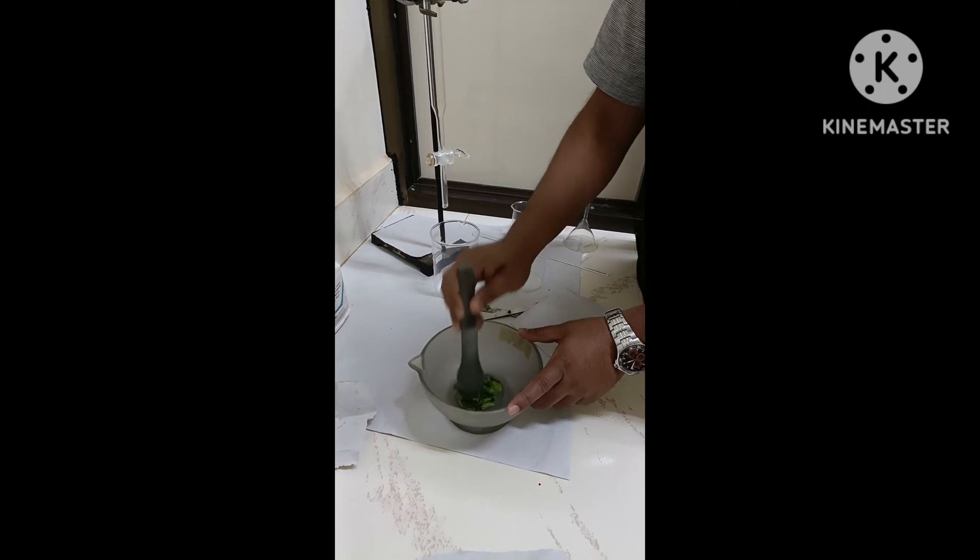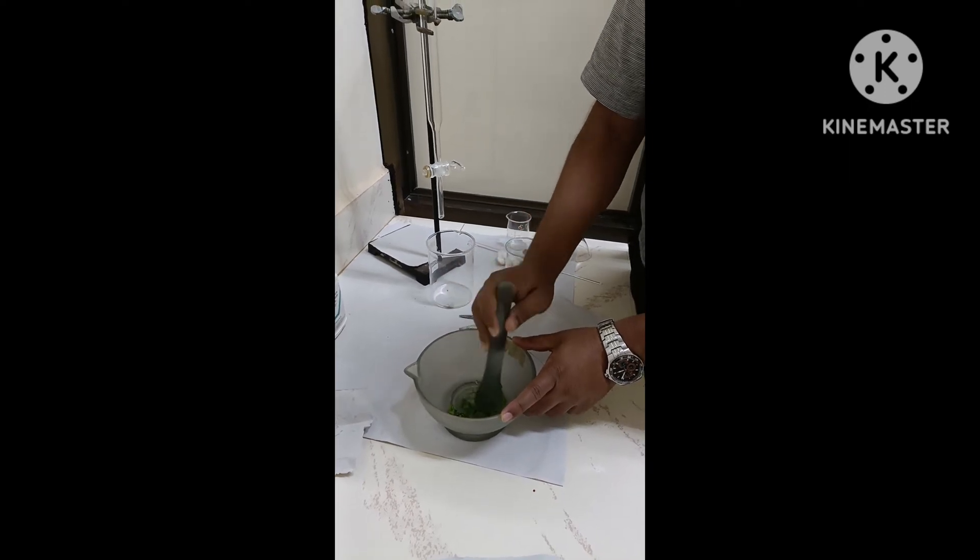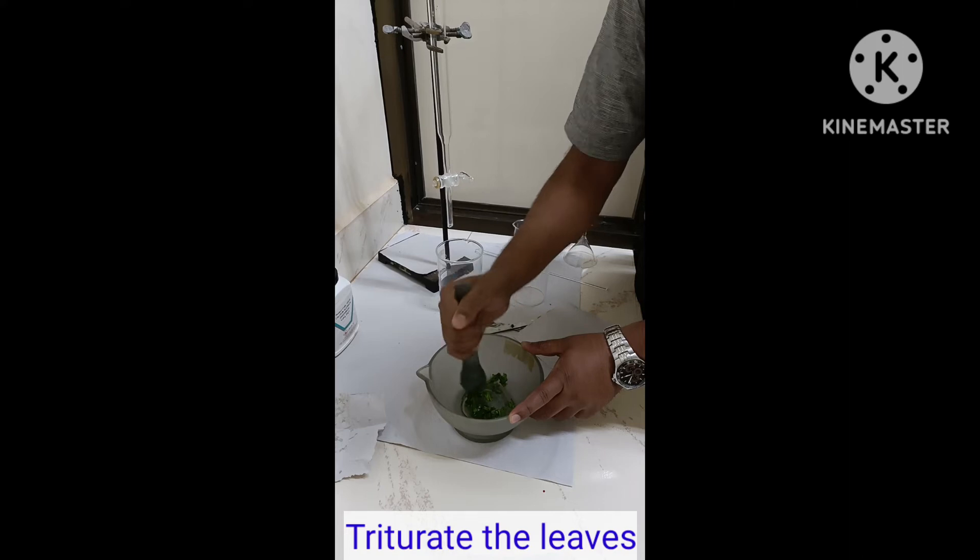Once you ensure that water is removed properly, then we have to triturate the spinach leaves using mortar and pestle.